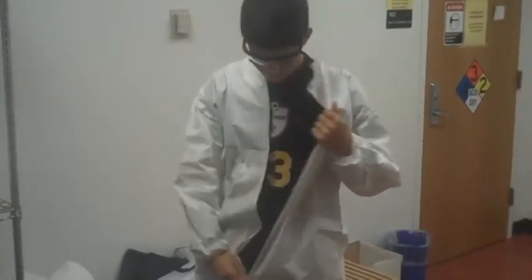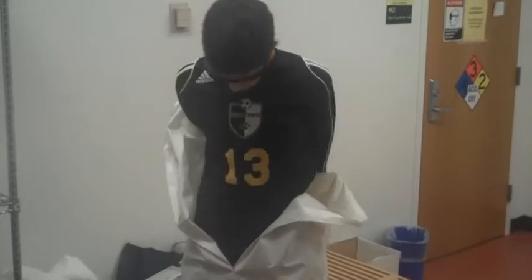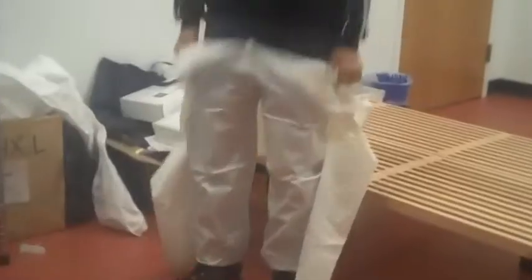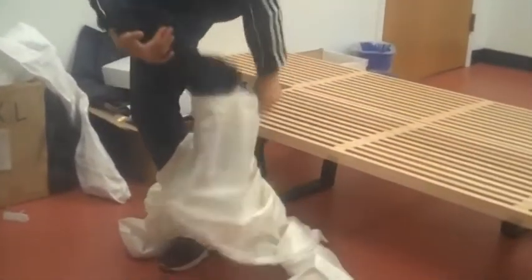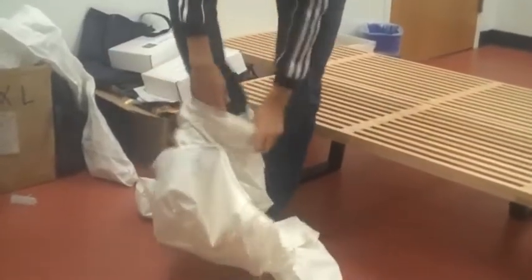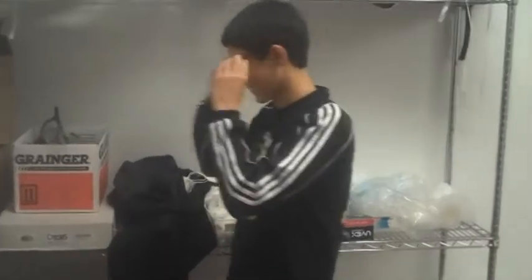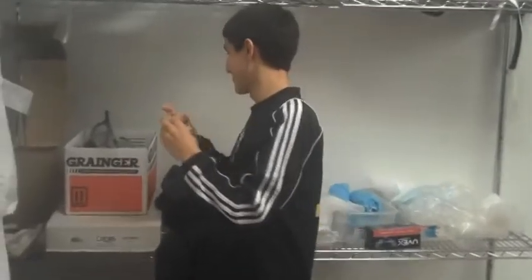Once you're done with those, unzip your white jumpsuit and throw that out as well. Lastly, take off your safety goggles and return them to their box.